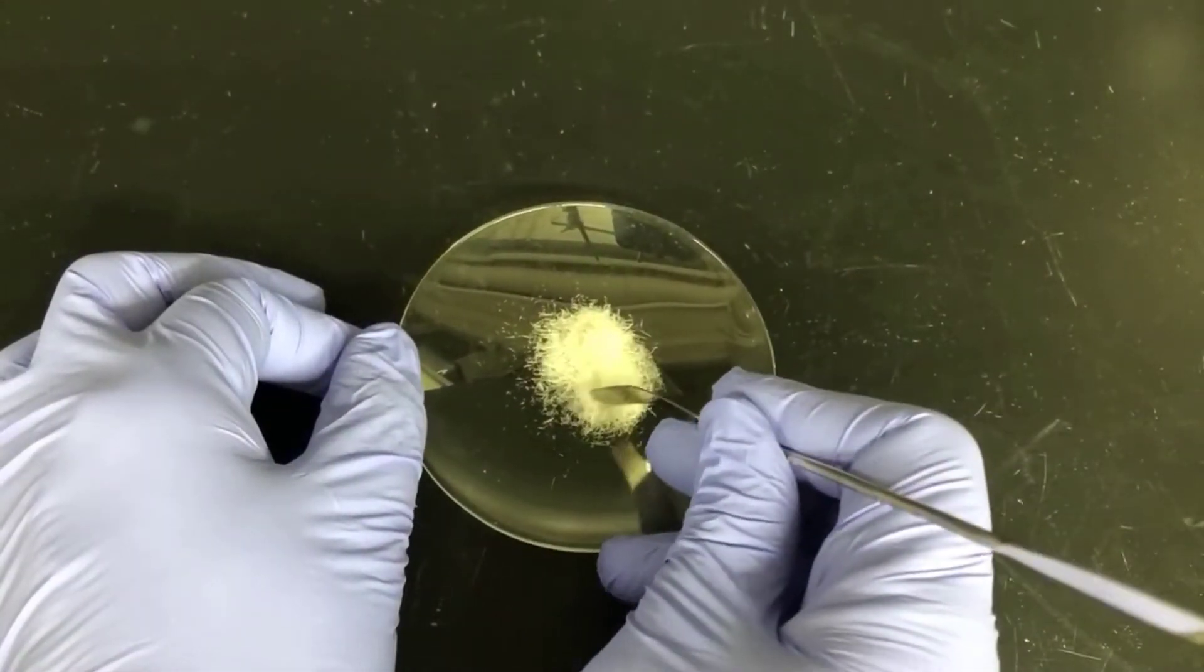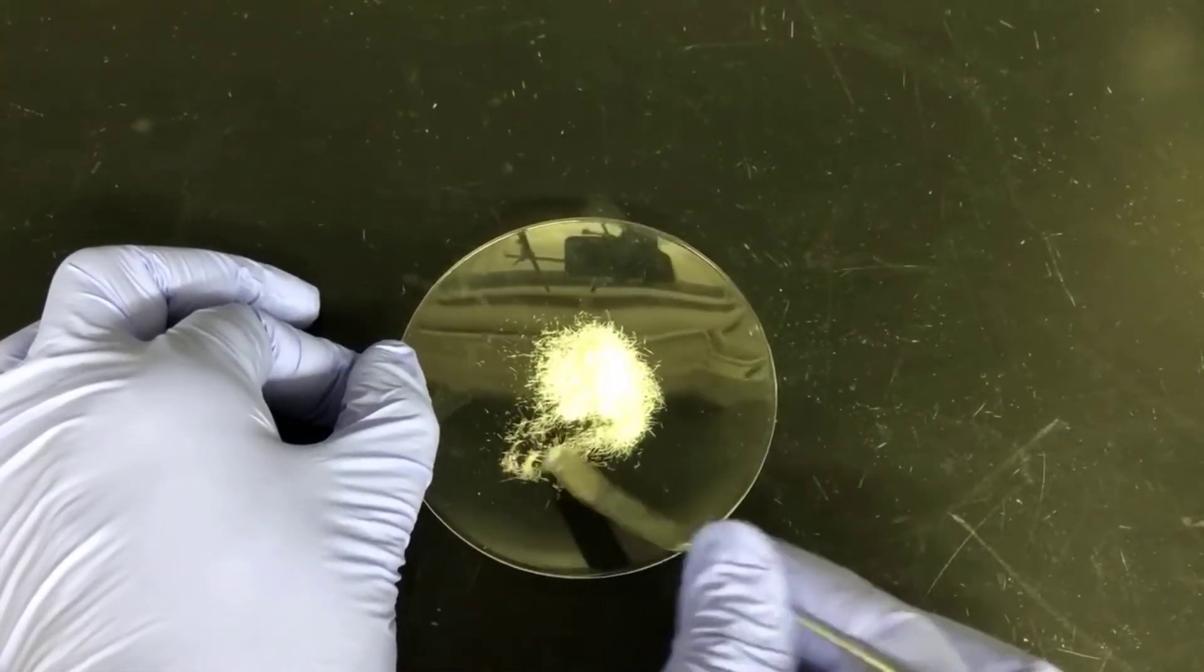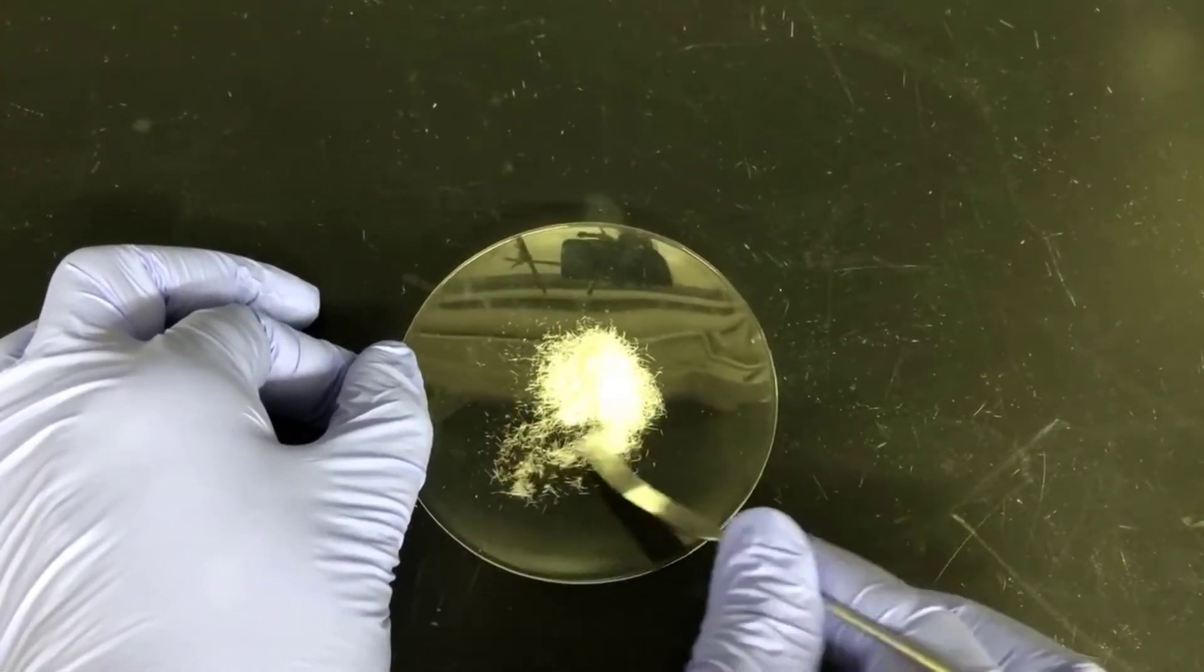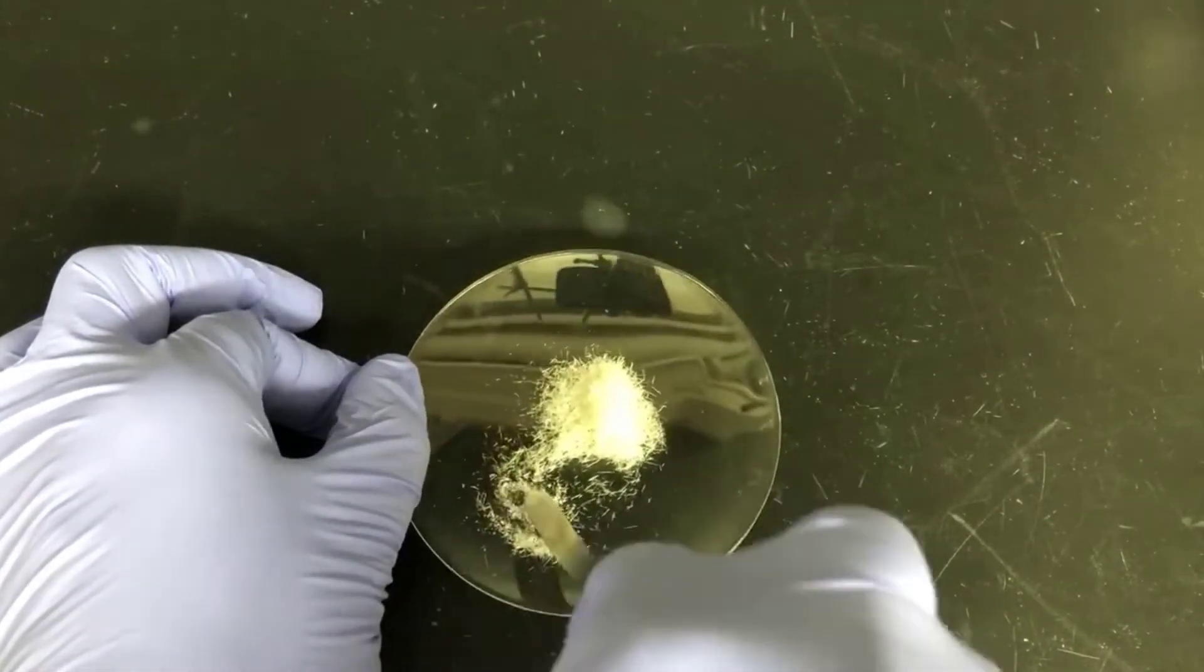I'll need to grind these crystals to a powder to carry out the melting point determination. They need to be powderized in order to get them into the melting point capillary tube, and it's important that the powder pack together in the capillary tube during the melting point determination as well.